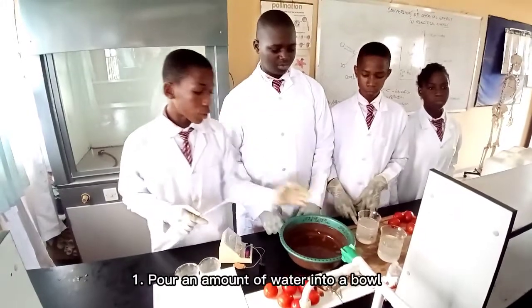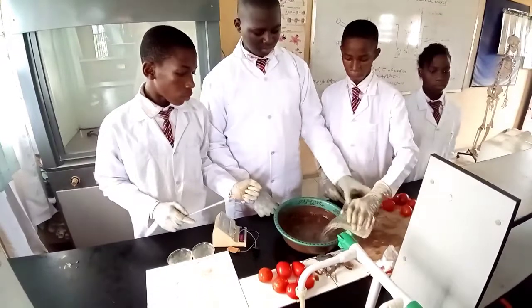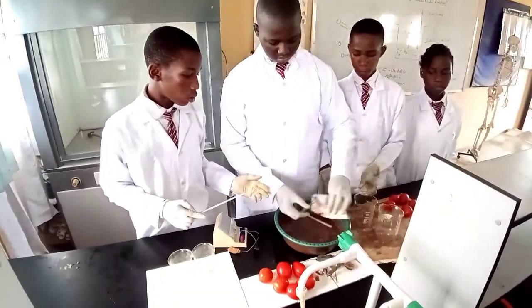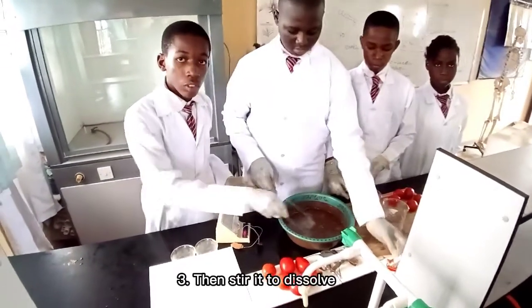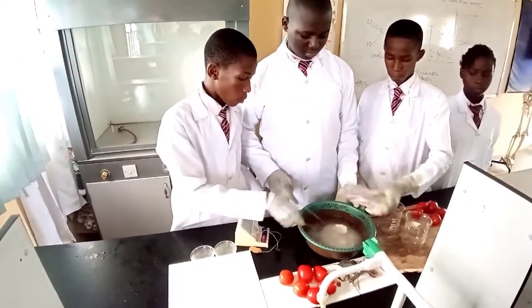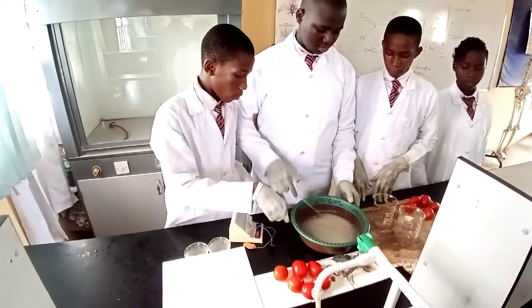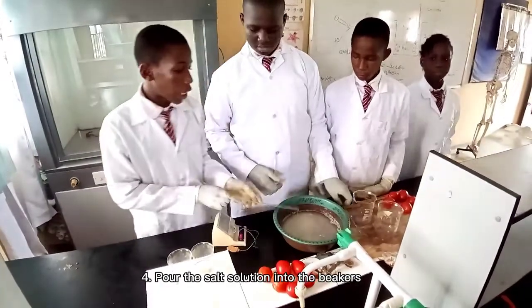Pour an amount of water into a bowl. Put in the sodium chloride, also called the salt. Then stir it to dissolve. Pour the salt solution into the beakers.